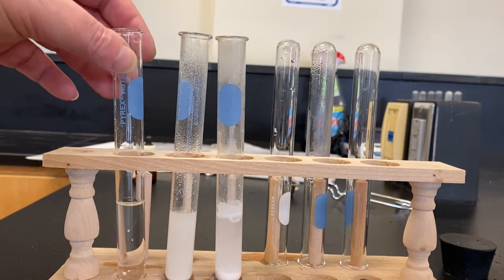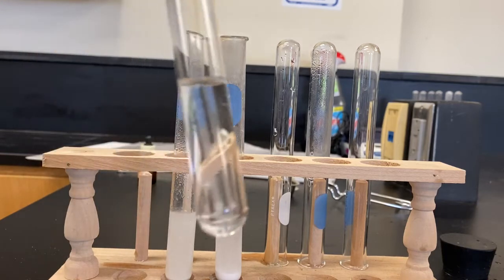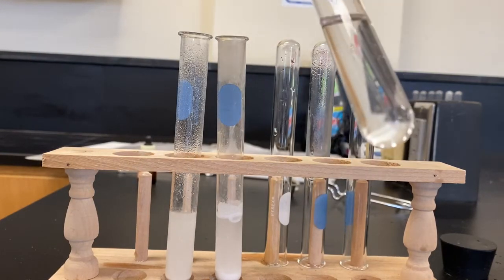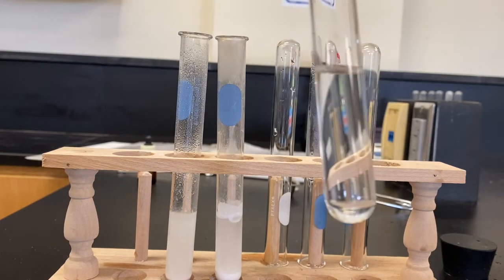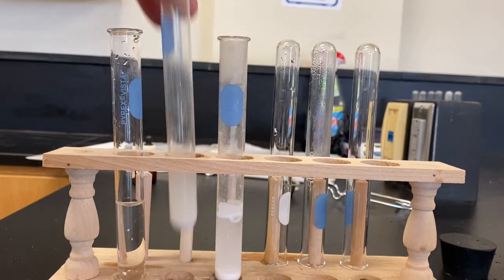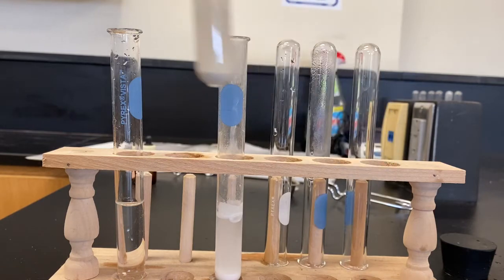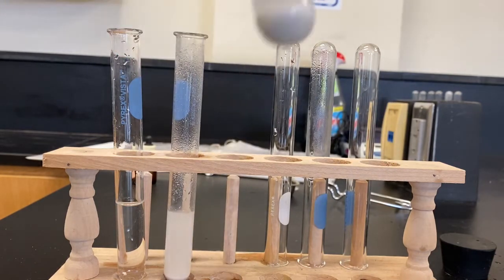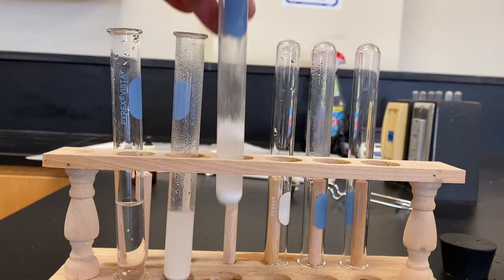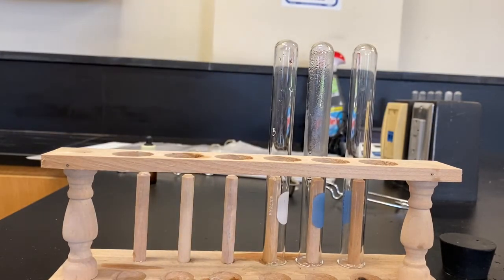The contents have been thoroughly stirred. Here is the magnesium sulfate after it's been stirred, here's the calcium sulfate, and here is the barium sulfate. Let's hold these next to each other, because remember this lab is comparative.